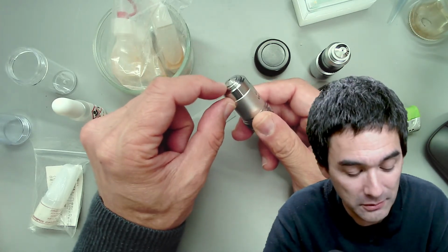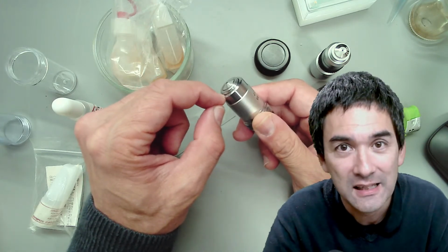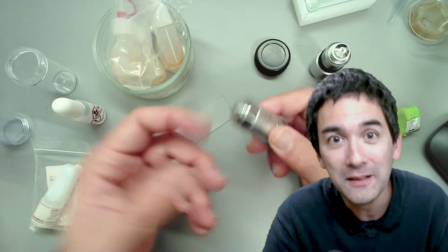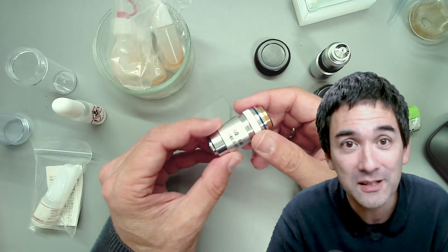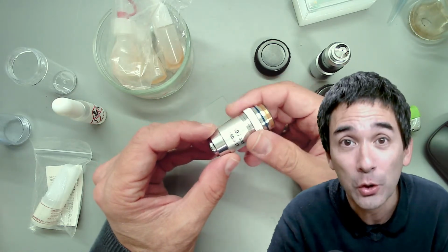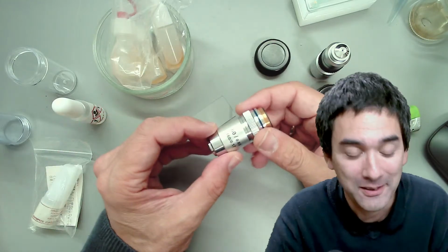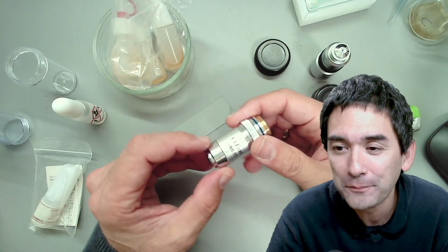You see, there are gaps in here, right? Somehow it went into the lens and behind the objective, behind the lens. So they had to completely disassemble it and clean everything. And if you consider that some of those research objectives actually cost several thousand euros or dollars, well, then you can imagine that it actually needed to be repaired, okay?